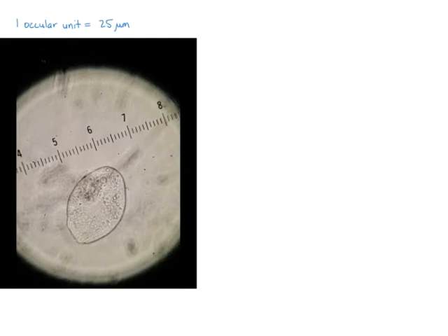To do this, look at a ruler under a microscope and then measure the distance between two markings. I did this beforehand under this specific magnification and I got one ocular unit is equal to 25 micrometers. Now measure the length of your organism under the microscope.